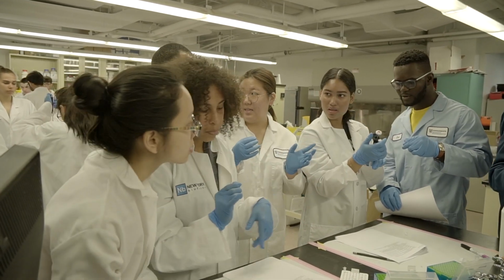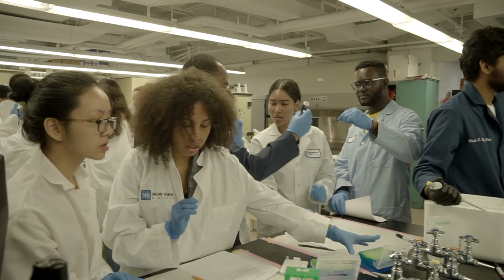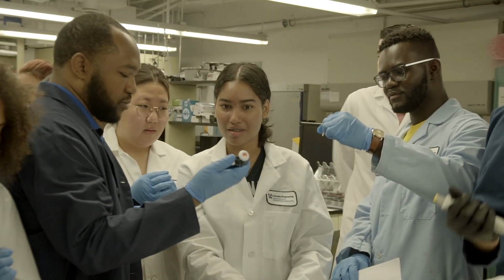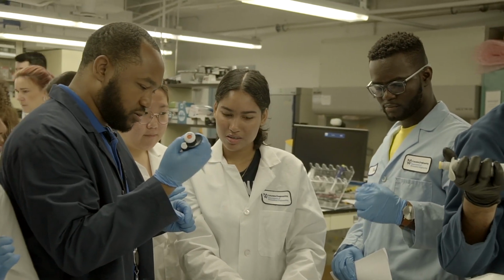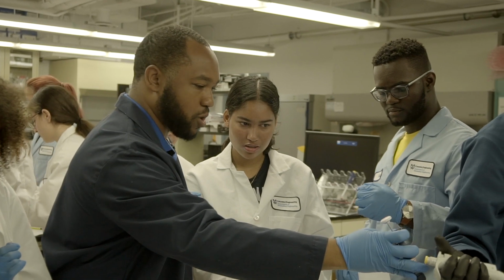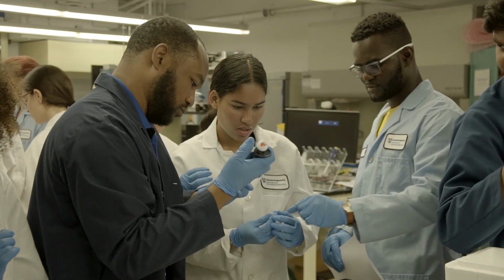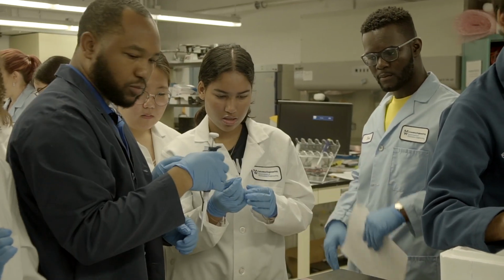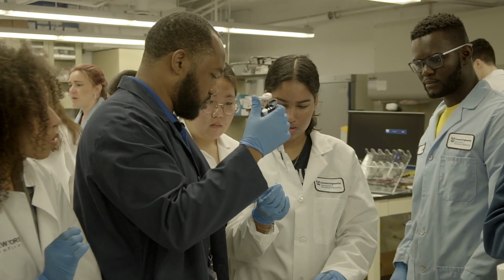Are we supposed to see it? You will, so how good are your eyes? Have you done it yet? Yeah. Okay. Did you see it when it was here? No. Okay, so where's the water? I'm looking. Do you guys have water? Or don't do it in there.